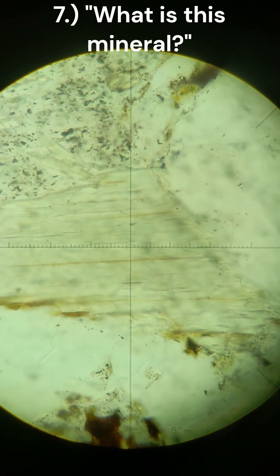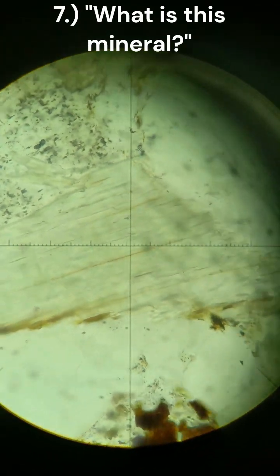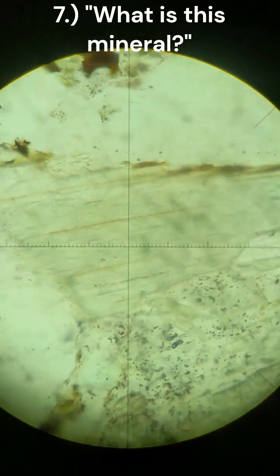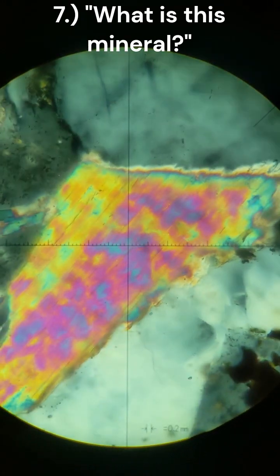Back in polarized, you can see what looks like a single plane of cleavage going across. No pleochroism on PPL. Going to XPL. Looks really weird.